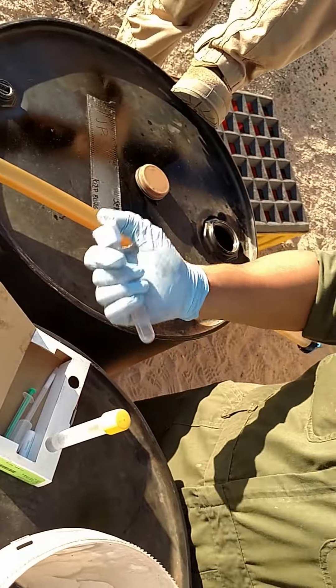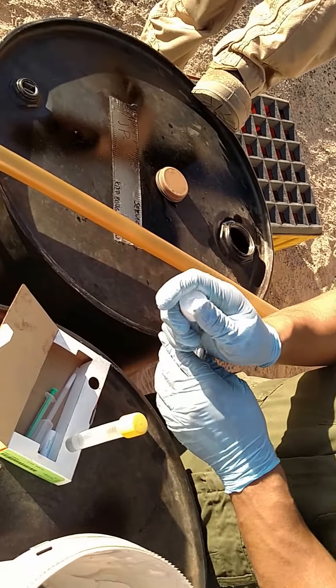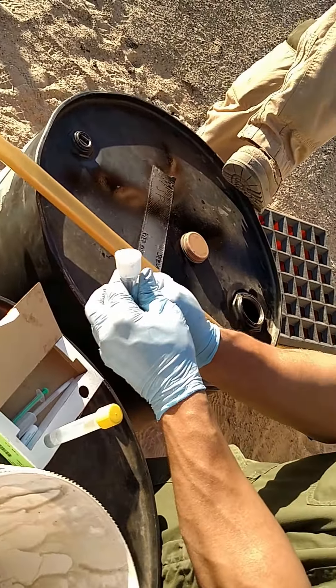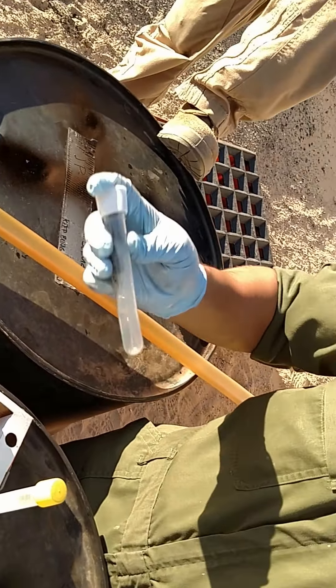You don't need that. All right, pop the top one — yeah, the top one. The metallic sodium, it's not going to explode on you. There's a dot on there that shows you where to press — there you go. Inspect the tube, make sure you didn't crack it. All right, shake it for 20 seconds.